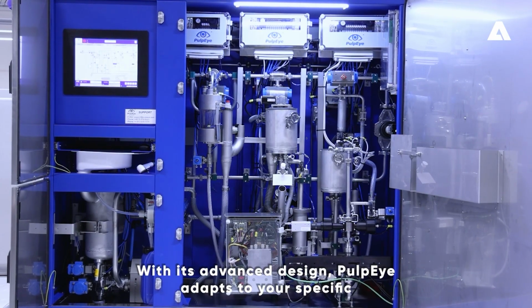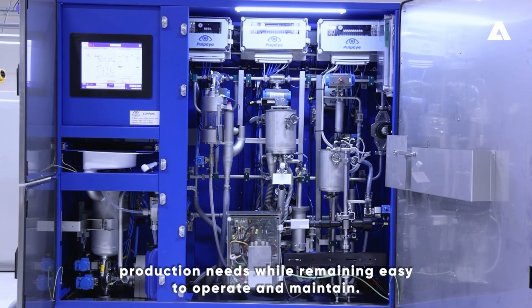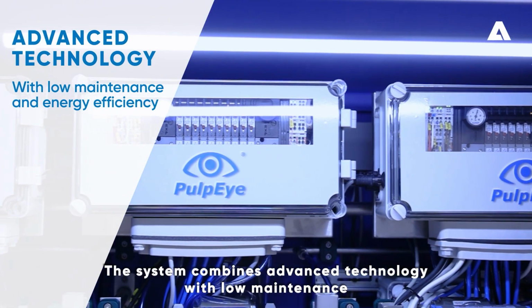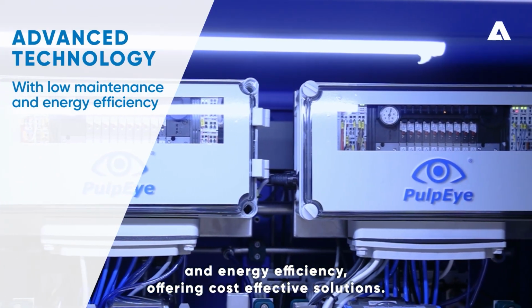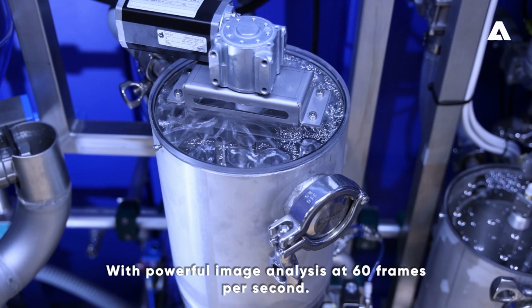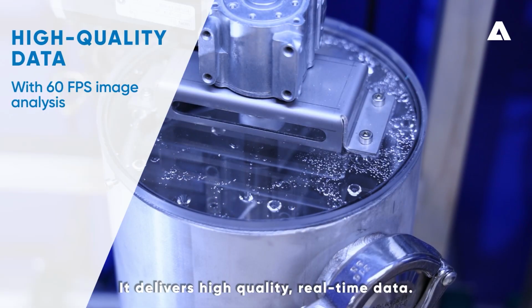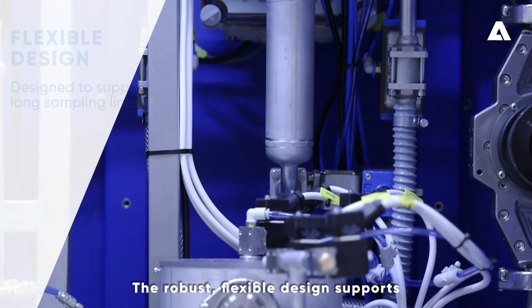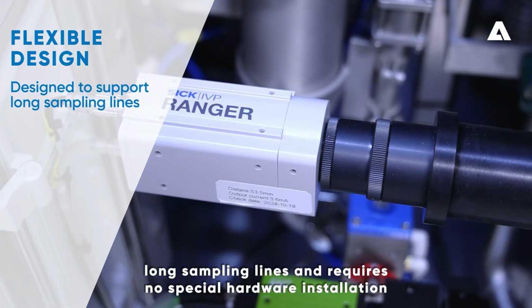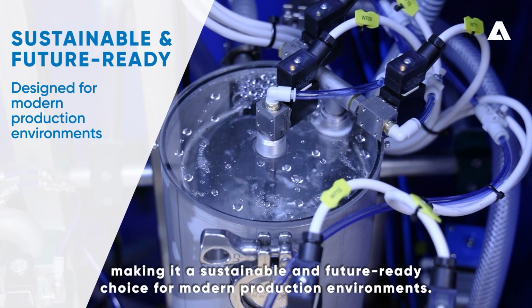With its advanced design, PulpEye adapts to your specific production needs while remaining easy to operate and maintain. The system combines advanced technology with low maintenance and energy efficiency, offering cost-effective solutions. With powerful image analysis at 60 frames per second, it delivers high-quality, real-time data. The robust, flexible design supports long sampling lines and requires no special hardware or installation, making it a sustainable and future-ready choice for modern production environments.